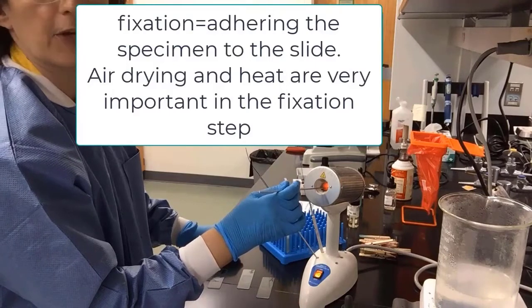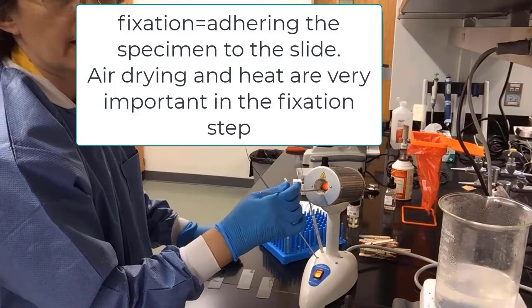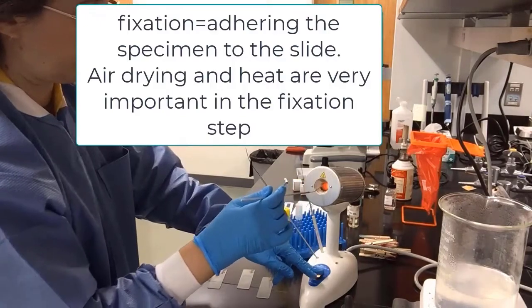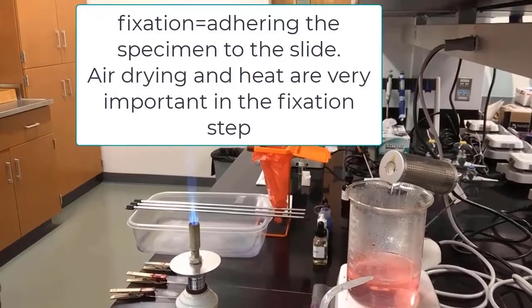So after labeling and creating the smears, we will move into the fixation step, which means we adhere the specimen to the slide. We do this in 2 ways. First, we air dry and then we heat fix. We will wait now to air dry these slides for about 10-15 minutes.